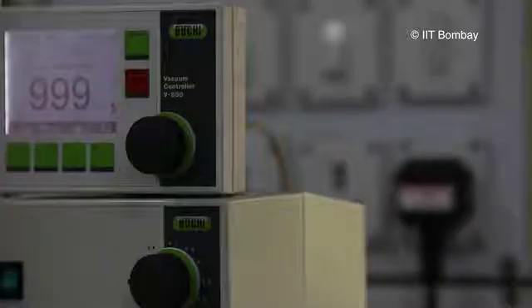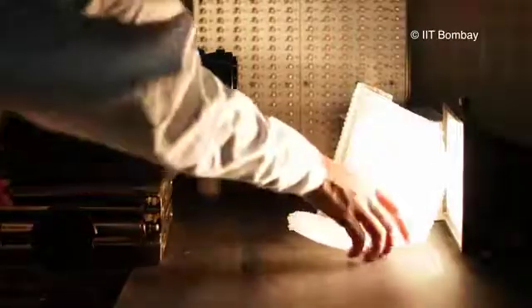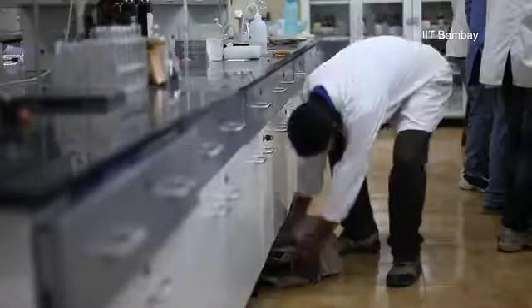Electrical equipment switched on overnight can become a source of fire if a fault develops — switch off equipment after use. Protect electrical cables from damage. Make sure you keep combustible materials away from electric light fittings. Ensure routine maintenance of electrical appliances. Maintain good housekeeping in your laboratory and remove unwanted combustible materials.